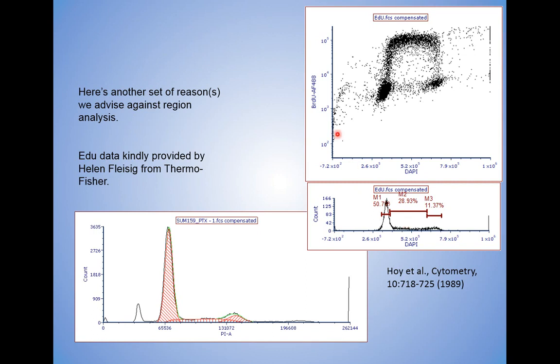And then before I get too distracted, the BRDU originally came out in 1989, so this has been around for a bit. But here's the region analysis. I have S, G2M, G1, G0 here. I come all the way up. These guys right here are the G1, G0. These are the G2M. What about these guys? They're in S.